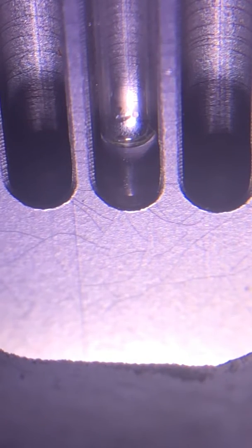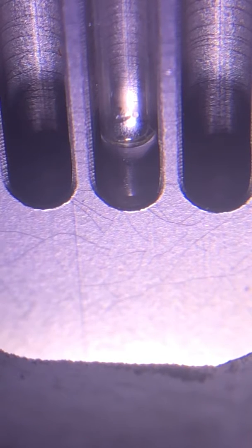So about 121 ish to 122 and a half, 123, somewhere in that range.